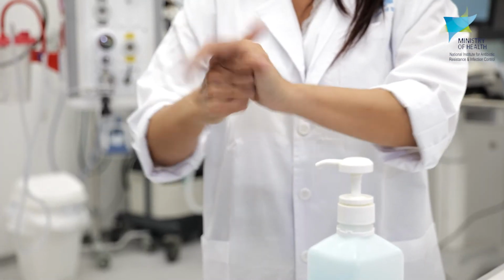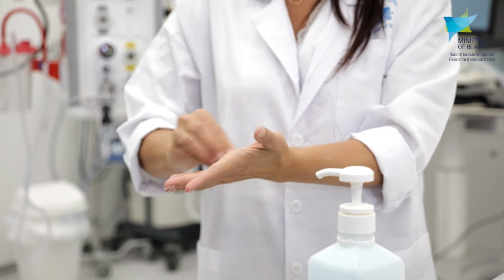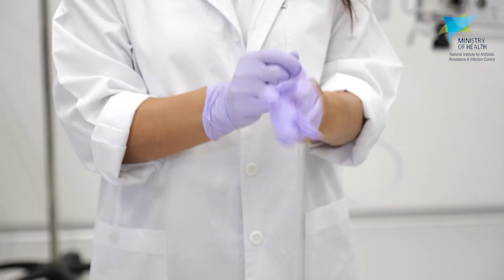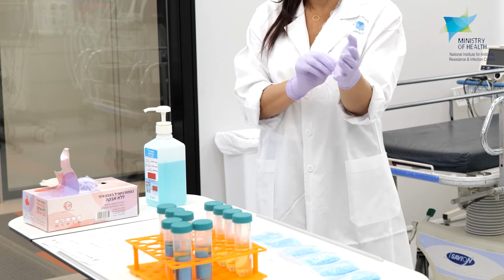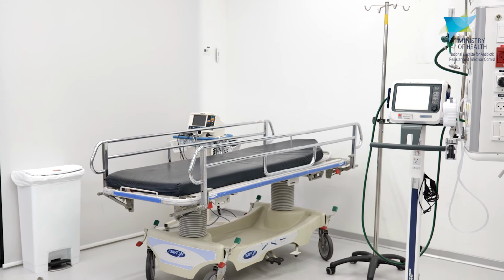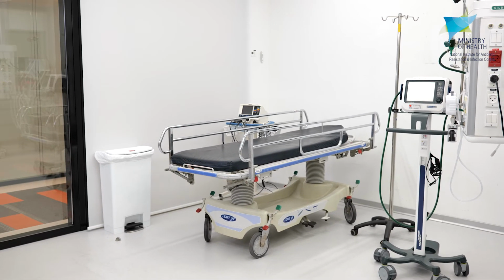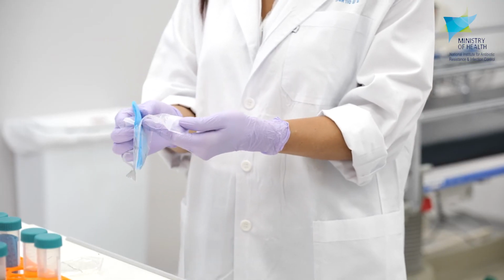Choosing which objects to sample depends on the reasons for sampling. For example, sampling might be performed to locate the source of an outbreak, to audit the quality of cleaning of the patient environment, equipment, and common surfaces, or to examine whether patient care is being performed according to principles of infection prevention. When we want to detect the source of an outbreak that may have originated in equipment, we should sample all of the equipment and instruments in the suspected area.